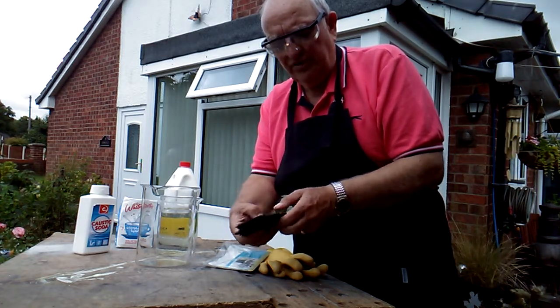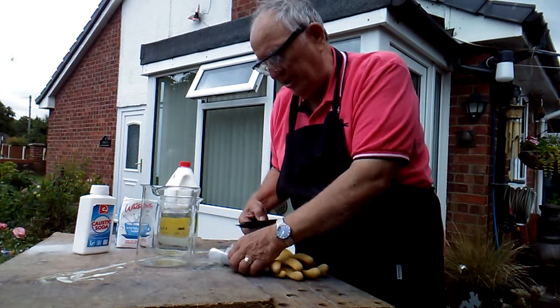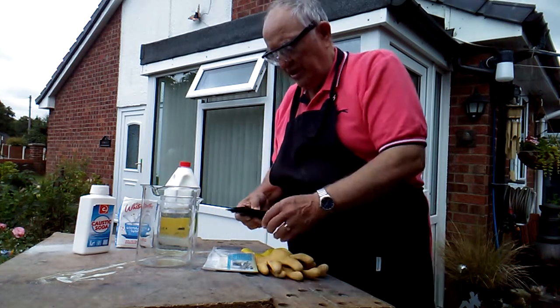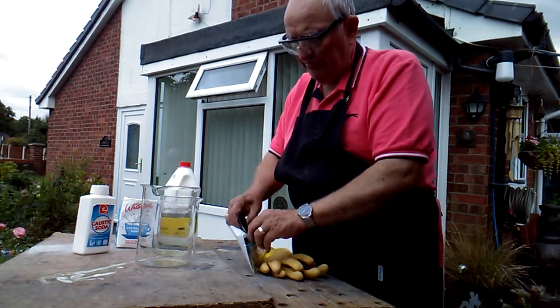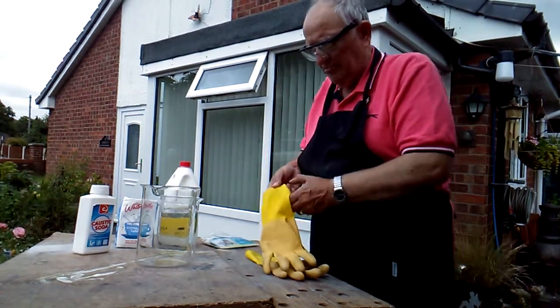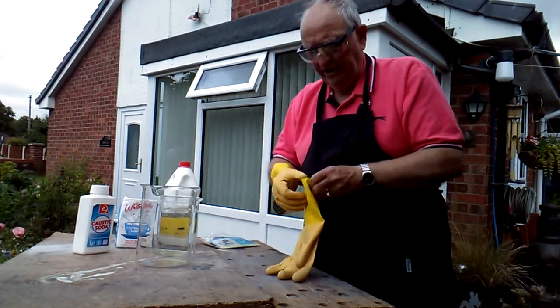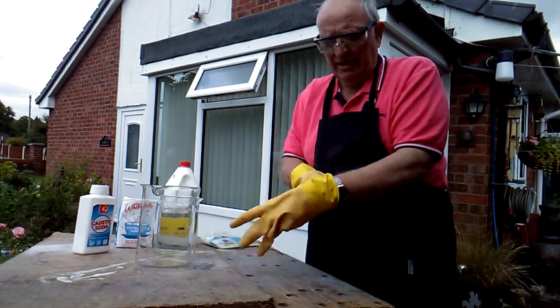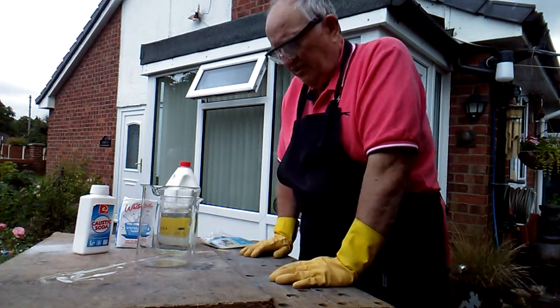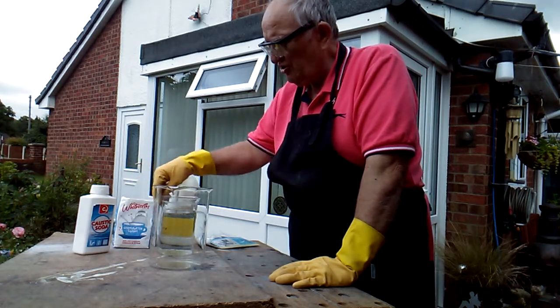This is about a quarter of the films I've got. I've weighed these and written it on this little bit of paper here — there's 100.6 grams, just over 100 grams of films. Now I've got my safety glasses on already and my overall. I'm going to put some rubber gloves on now because although these chemicals aren't really dangerous, you don't want to get them all over you and they're a bit smelly. Always wear your protective gloves because if you splash any in your face, it's obviously not going to do you any good.